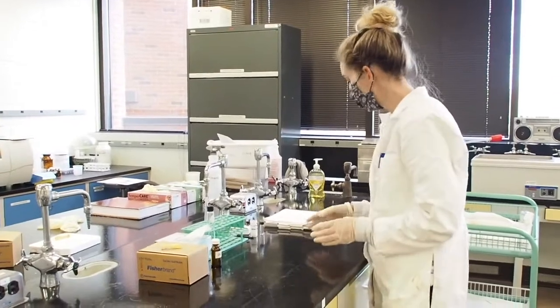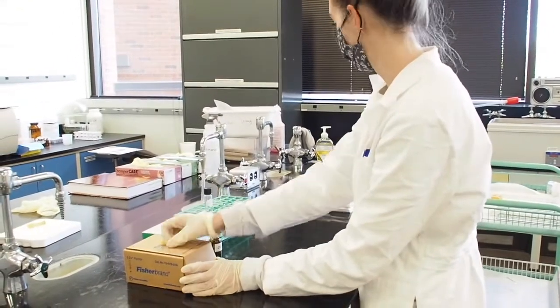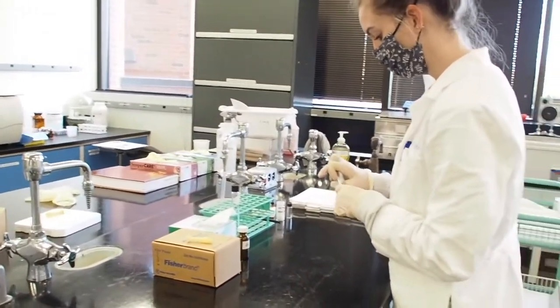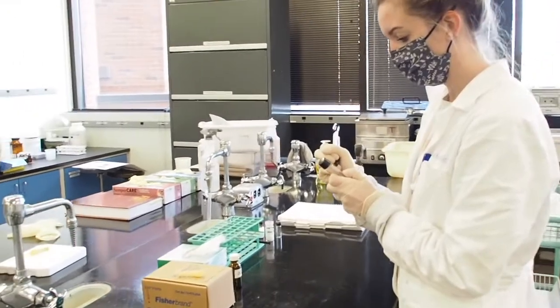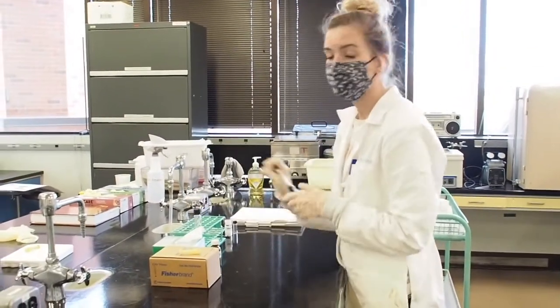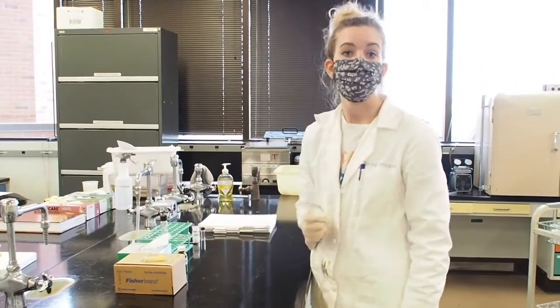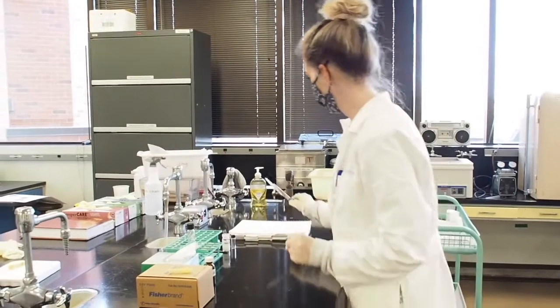The first thing you're going to do is put 2 drops of oil into your glass tube. And since I am doing oil E, I am going to label my tube with an E on it. This way, if we have multiple tubes in the water bath, then we won't get them mixed up between person to person, and we know exactly which sample is what.